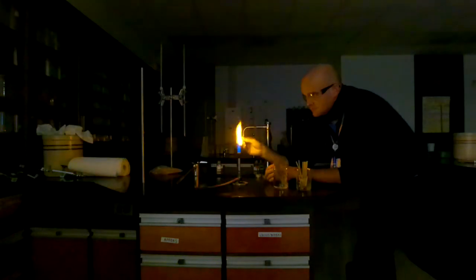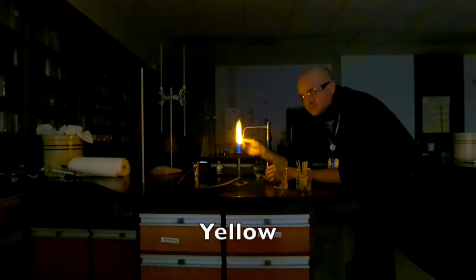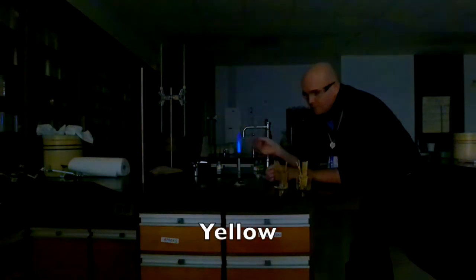And sodium nitrate. So you should compare this with that sodium chloride that we just did. Will that nitrate or the chloride, will that anion, that thing at the end, will that matter? You decide. Is it going to be the same color? What do you think? Ooh.